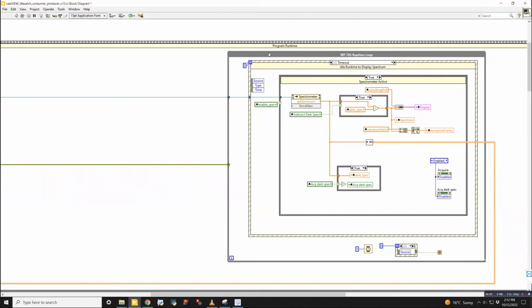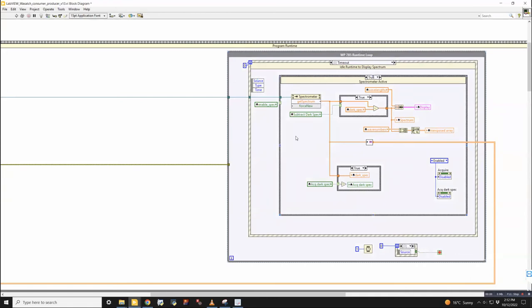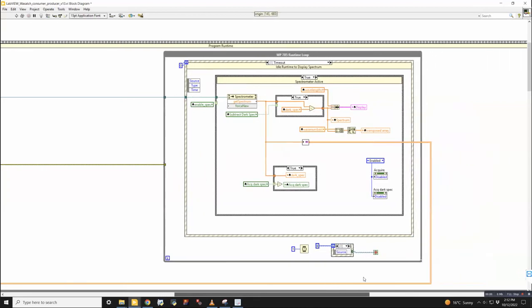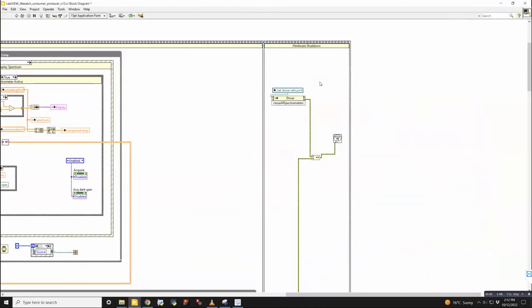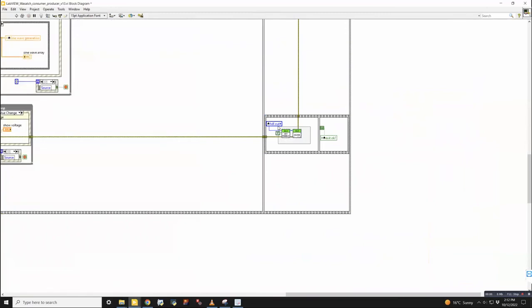So in the default case, what would be happening here, and not doing any file saving or anything, is that we initialize the spectrometer to run, and then the program runtime loop is every time there is a new spectrum that comes in, it will display it in this window and update it. And then when we click shut down software, it will initialize this event, which will hit the stop button here and in all the parallel running while loops, and send it into the final frame, which is hardware shutdown. So this one here shuts down the spectrometer. And then this one here shuts down the K-cube.